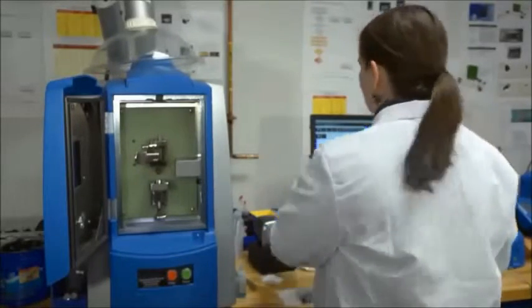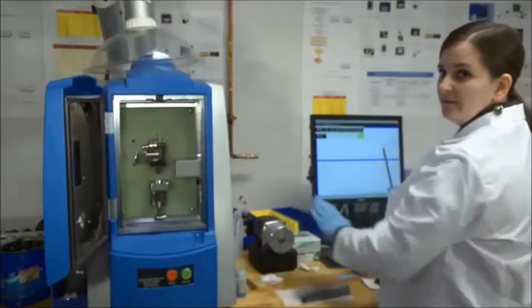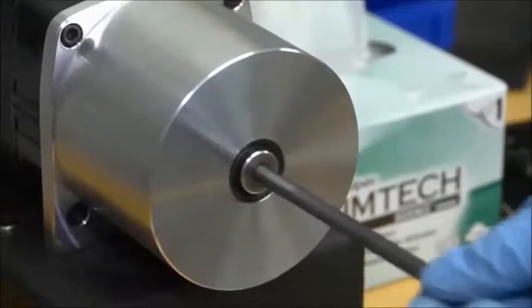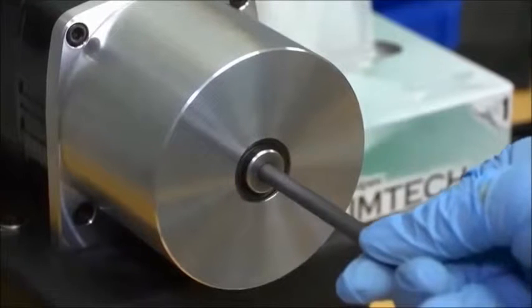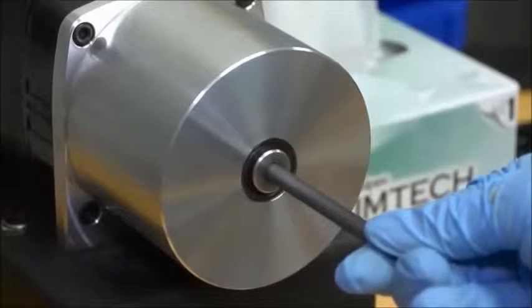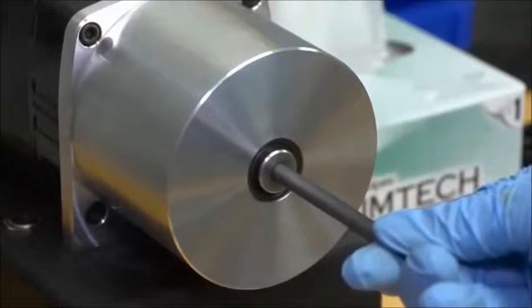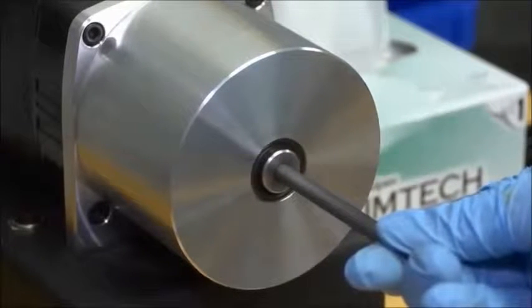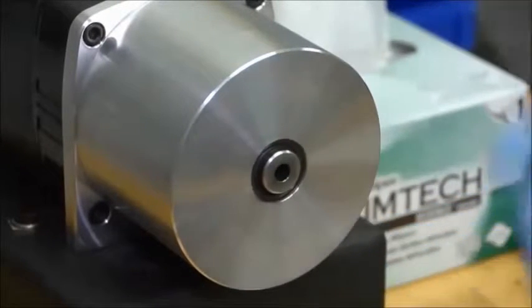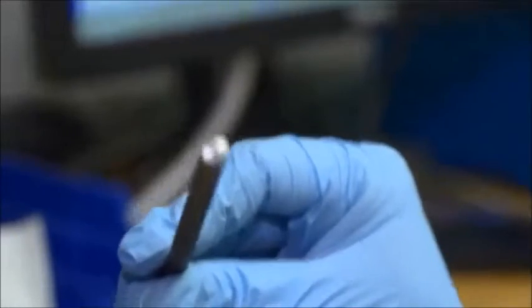And then the rod. I'm going to sharpen it with the sharpener, and you'll see that you have a nice angle and shine on the tip.